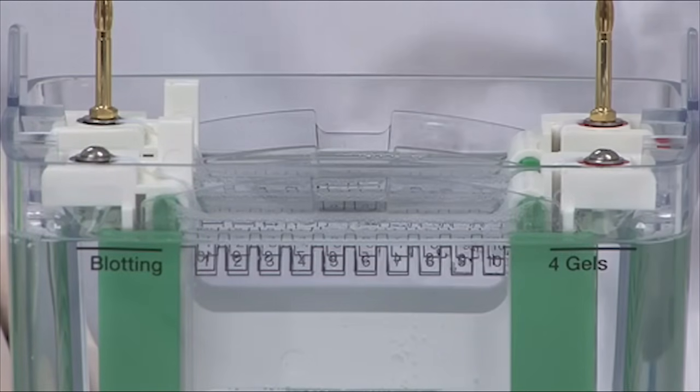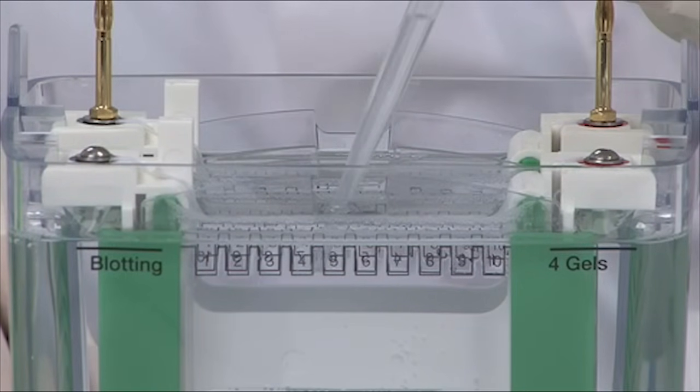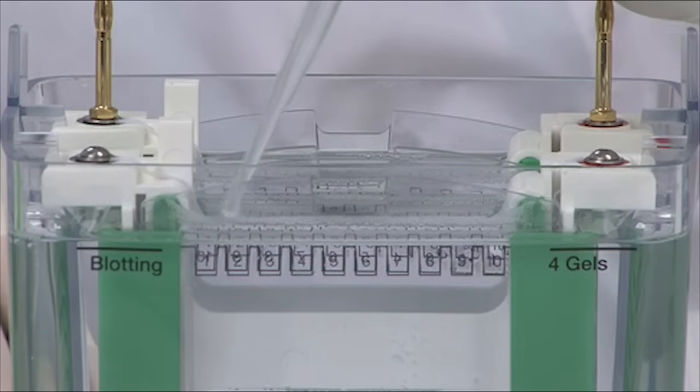The next step is to rinse the wells of your TGX gels with buffer from the tank using a transfer or Pasteur pipette.